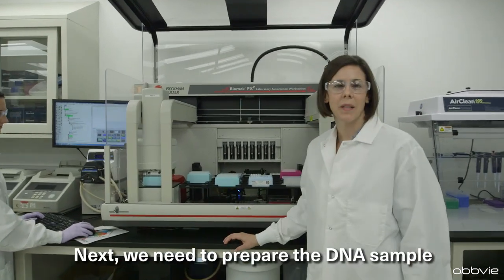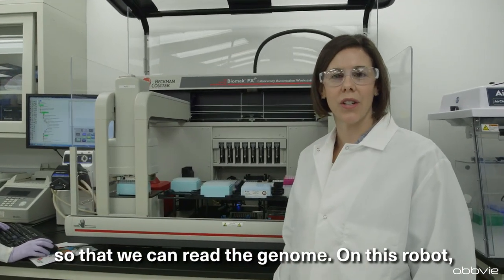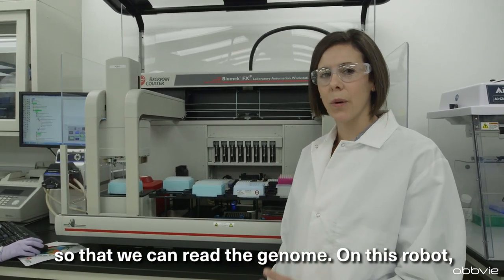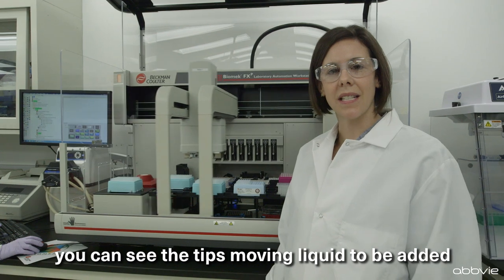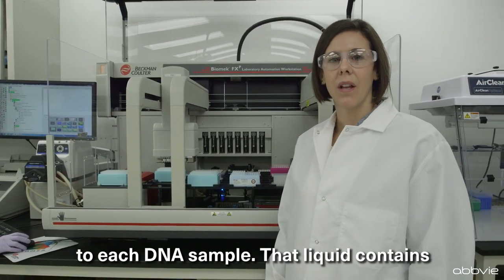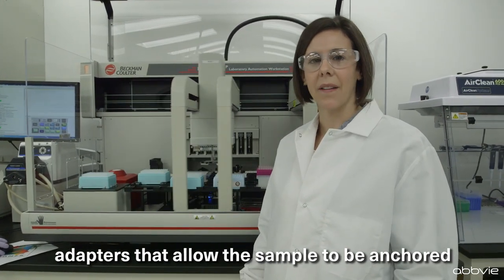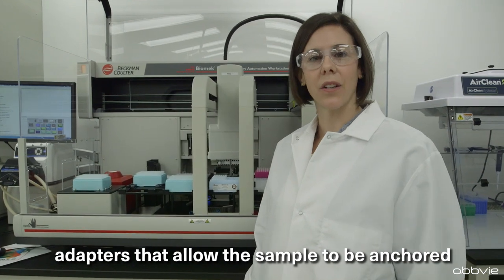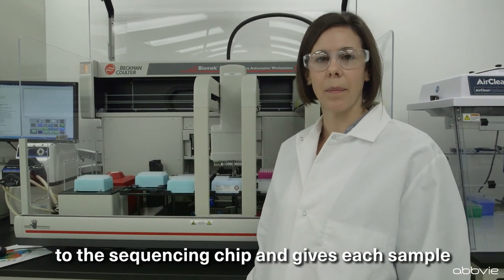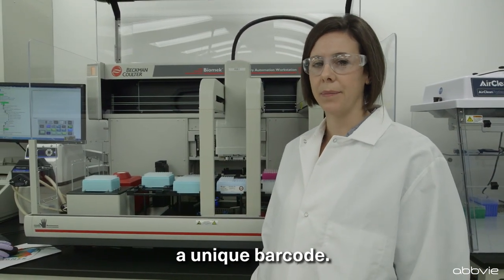Next, we need to prepare the DNA sample so that we can read the genome. On this robot, you can see the tips moving liquid to be added to each DNA sample. That liquid contains adapters that allow the sample to be anchored to the sequencing chip and gives each sample a unique barcode.